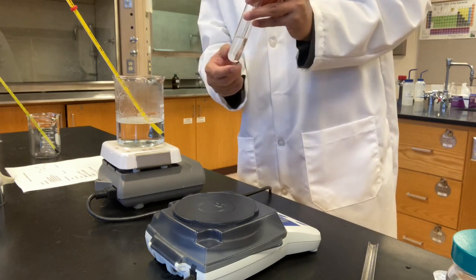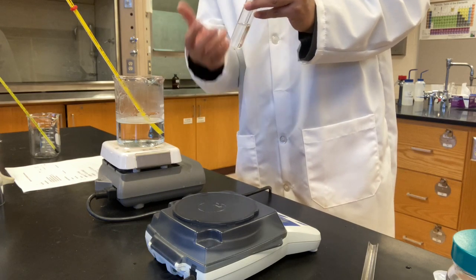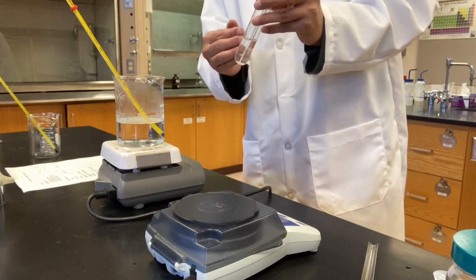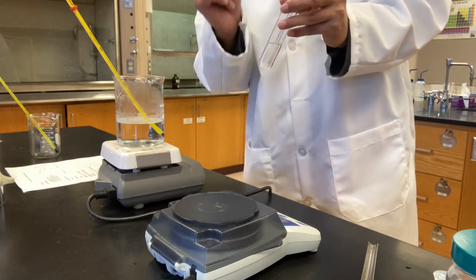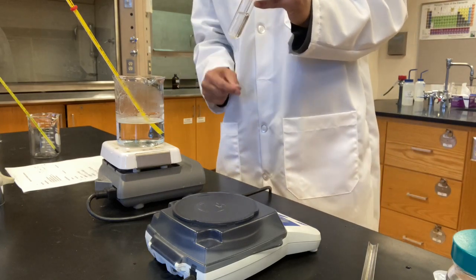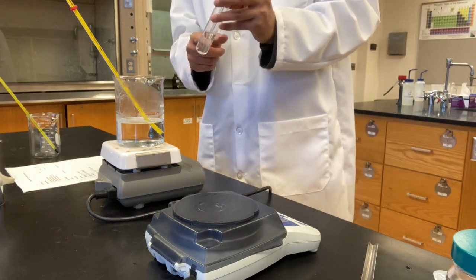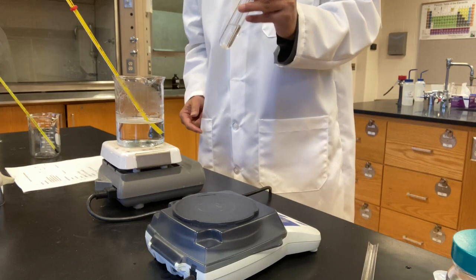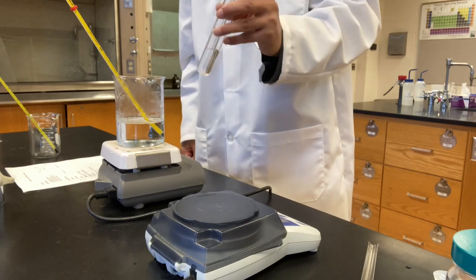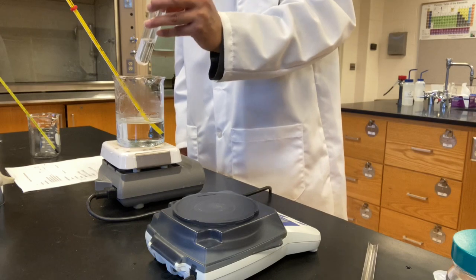Then the amount that was dissolved at 50 degrees Celsius or higher temperature later on cannot be dissolved anymore at lower temperature. So solid will start to come out. We will record the temperature when you see the first crystal coming out from the solution. You're going to take a record of that. After that, we're going to put it in the ice bath and observe what happened. You need to observe, write down your observation and explain why you observed what happened.